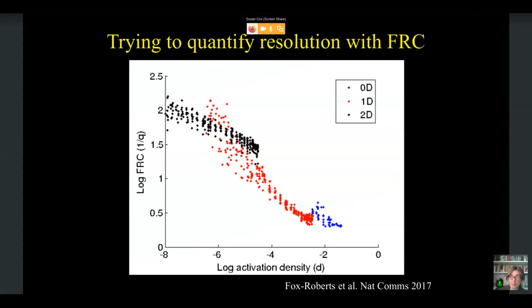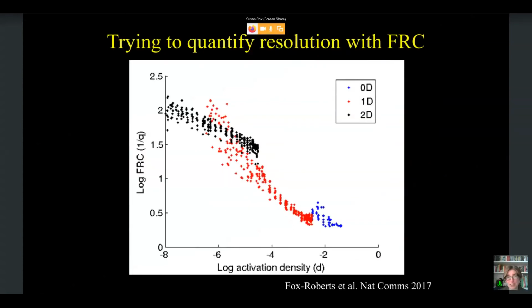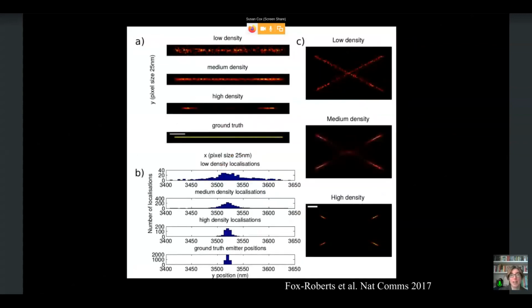And then we thought, well, we've shown this in a real sample. What we should try and do is to quantify these results, which we simulated, using Fourier ring correlation. And this is where it all went quite wrong, because we assumed that we would get a nice graph showing a turn-up, and we actually don't get that at all. What we see is the resolution that's reported just gets better and better as the activation density goes up. That's because Fourier ring correlation doesn't distinguish between sharpness and true resolution. All it can measure is the sharpness, and the image is always getting sharper as you go to higher activation density. As we showed before, any structure that wouldn't get sharper just disappears.